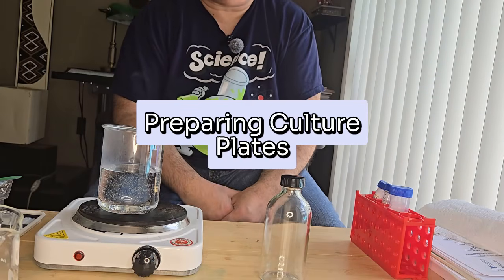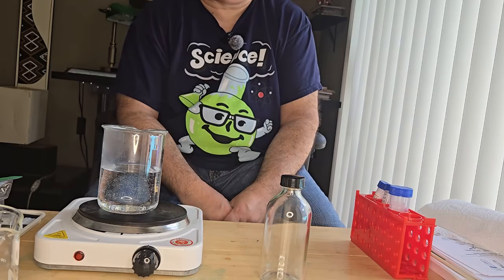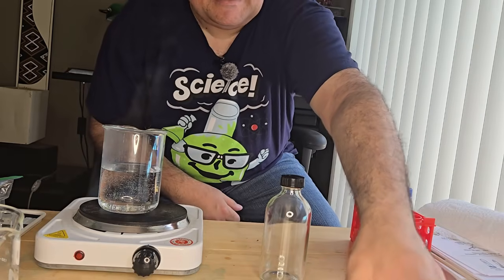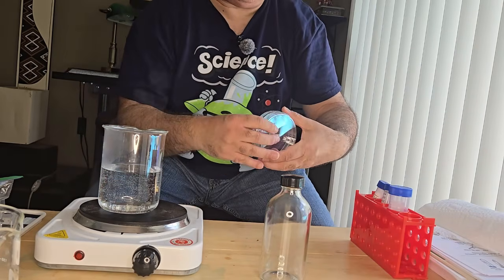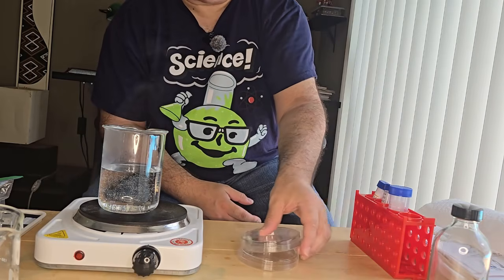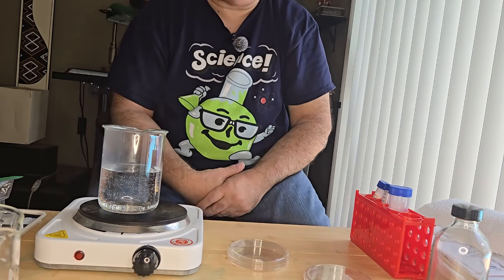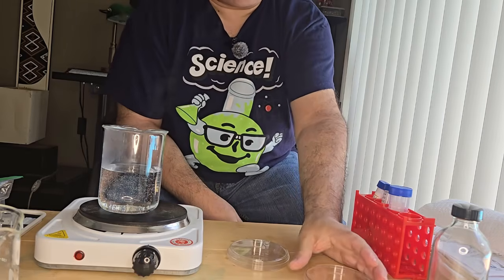Okay, the very first step in this CRISPR experiment is to prepare the plates, the culture plates. I need a plate that has LB agar to grow my E. coli bacteria.